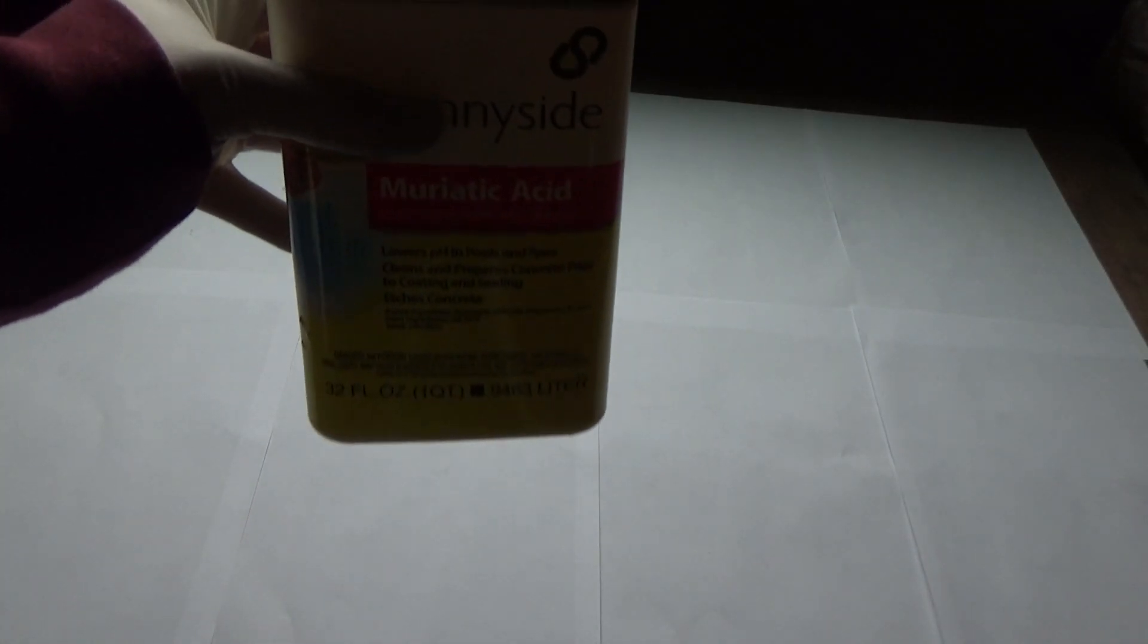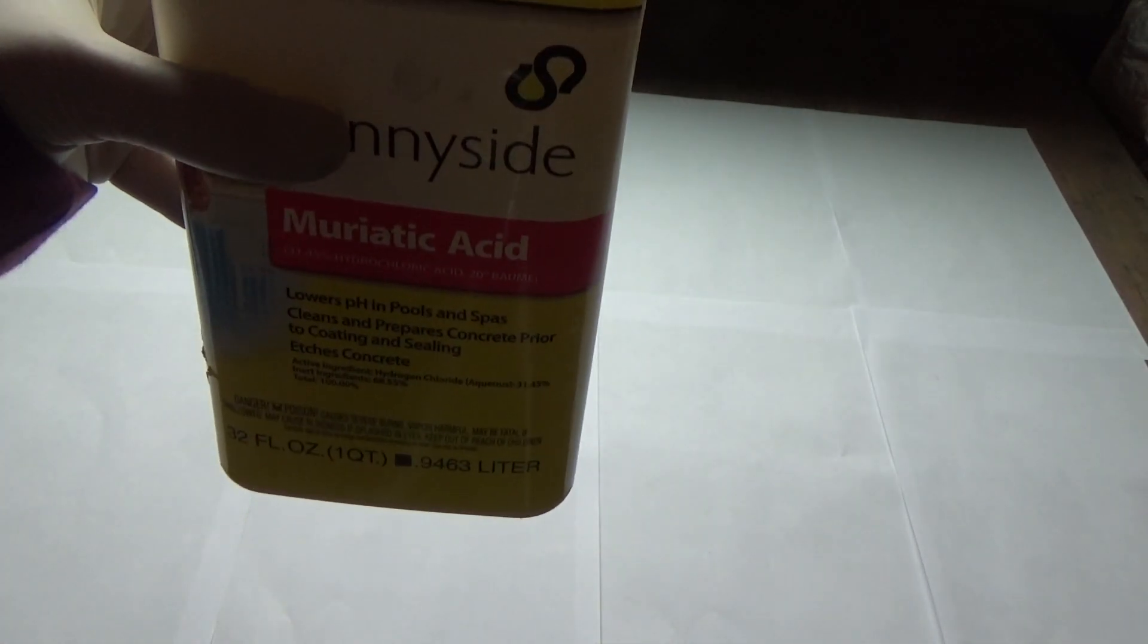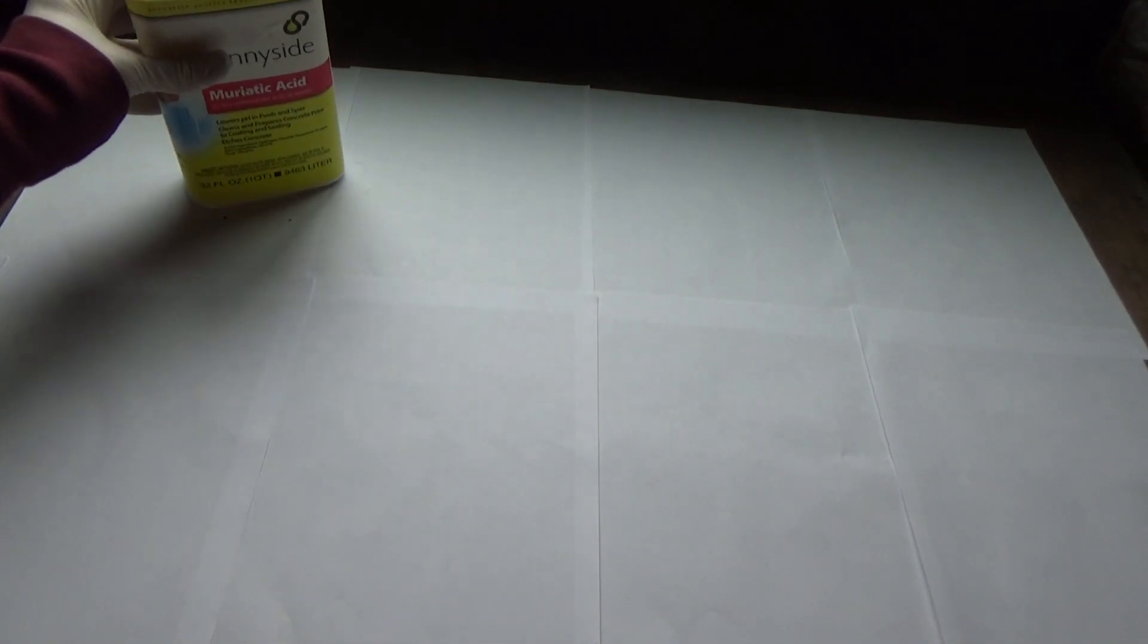But for the sake of me having it, I will be using this hydrochloric acid because it's better than toilet bowl cleaner. But toilet bowl cleaner will work if it's the right kind.